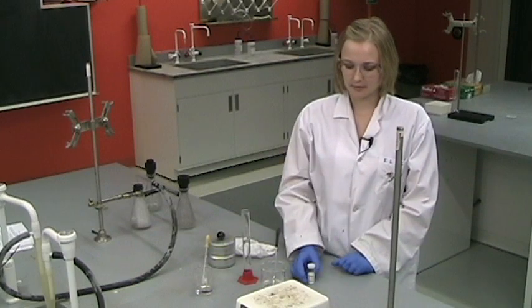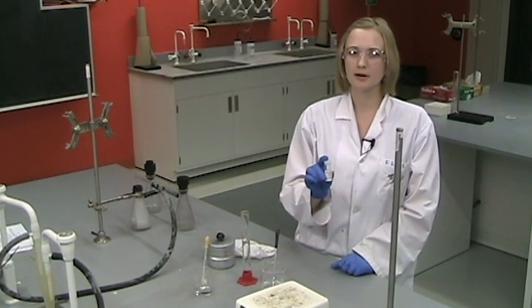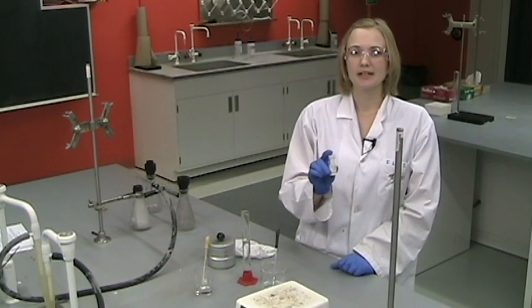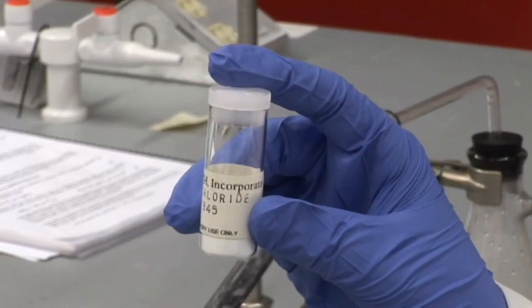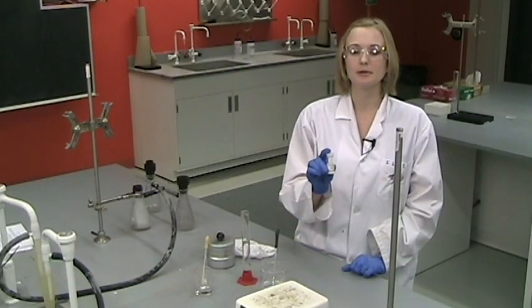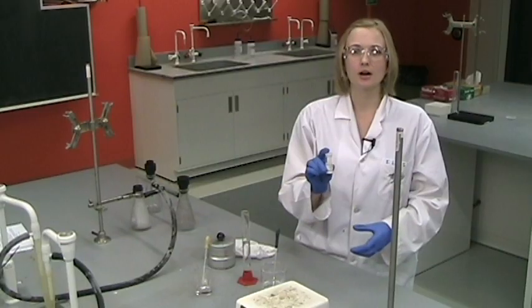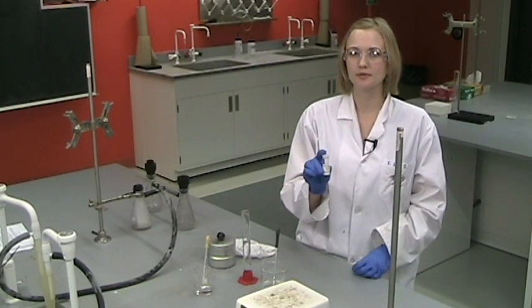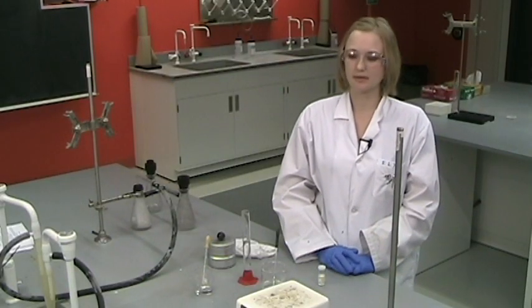The first part of the experiment will be to weigh out a sample, one for you, one for your partner, of your salt. Use the analytical balances at the back of the lab benches and put the vial on the scale. Remove some of the salt from the vial into a 250 ml beaker. Once you have the initial mass of the vial, put the vial back on. Take the difference in the two masses of the vial to find out how much salt you've removed. You want between 0.1 gram and 0.15 grams of the salt.